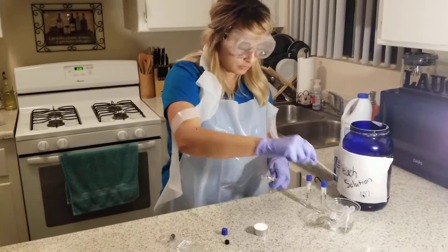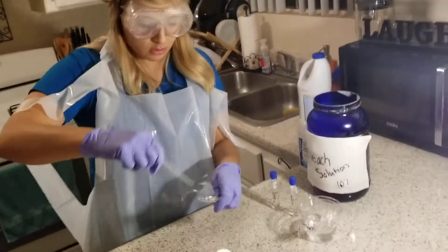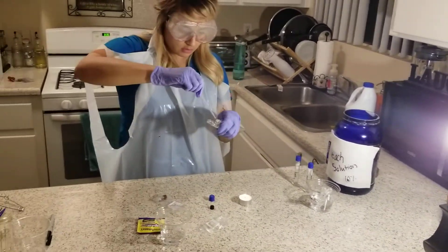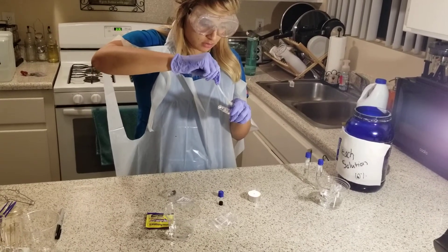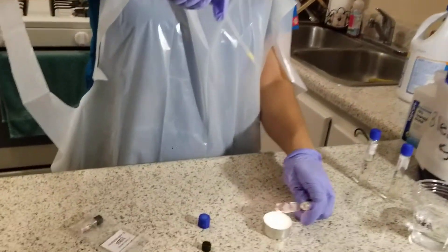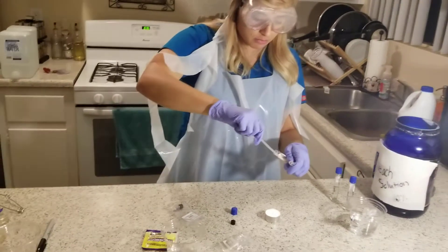Collect — make sure all the alcohol is out — and I'll collect 2.5 mL of the culture. Then make sure that there's no contamination. I'm going to heat it and then I will inoculate it into the broth.